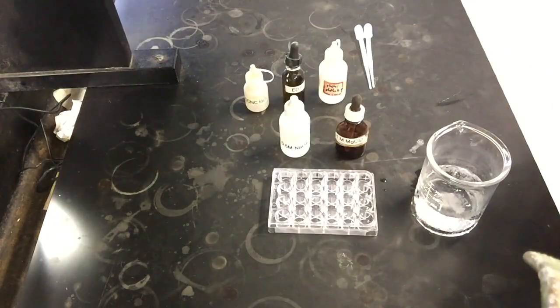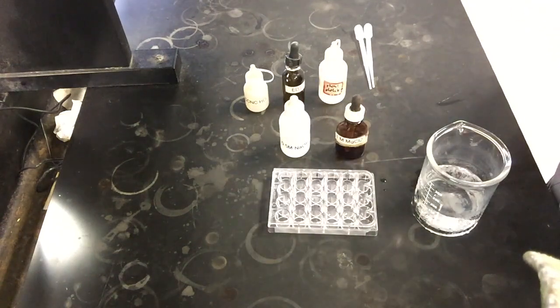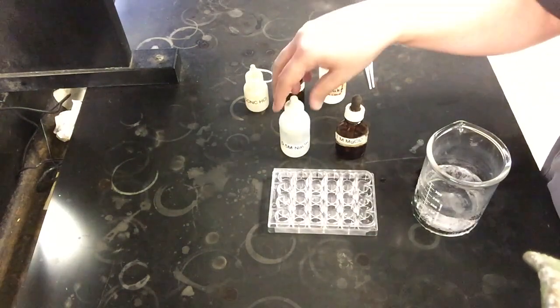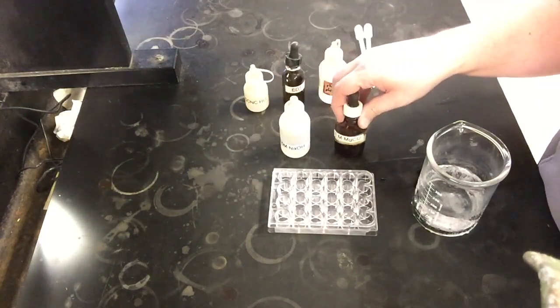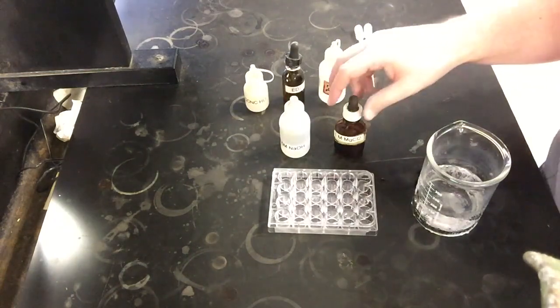All right, so for the second part of our experiment, we're going to be taking a look at the equilibrium that involves magnesium hydroxide as a solid, dissociating into magnesium 2+ and hydroxides. So just the general dissolution reaction with magnesium hydroxide. But we're not going to start with magnesium hydroxide itself. We're actually going to make it by reacting sodium hydroxide and magnesium chloride, which, if you think back to Gen Chem, is really a precipitation reaction.